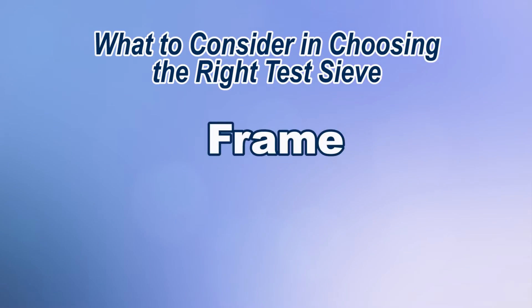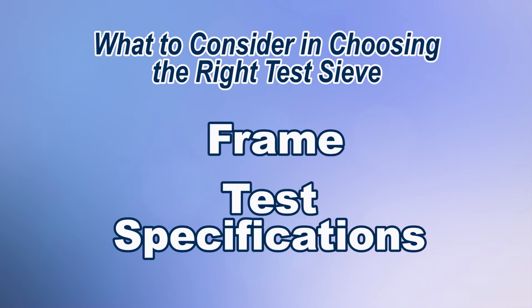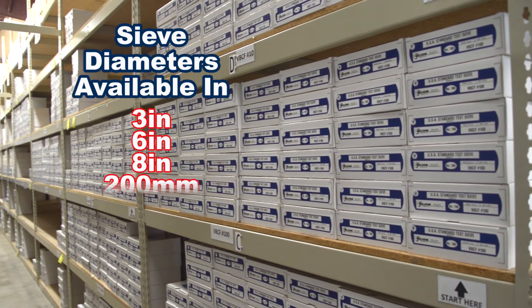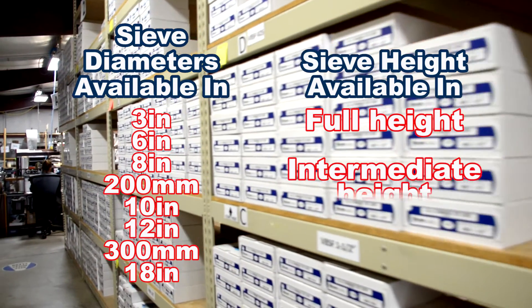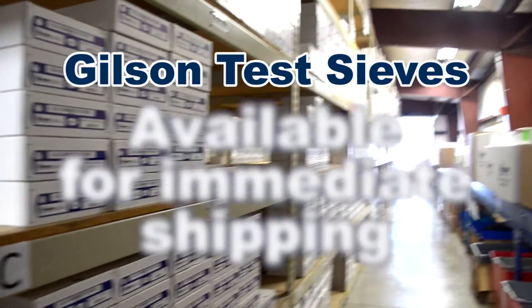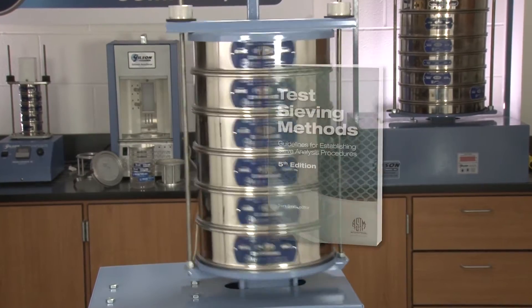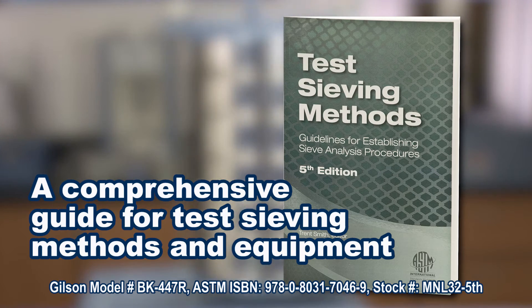It is important to consider the test sieve frame as well as the test specifications required when choosing test sieves for performing gradation analysis. Gilson offers test sieves from 3 inches to 18 inches in diameter, as well as test sieves in full height, intermediate height, and half height sizes, with the most popular sizes available for immediate shipping. Gilson also offers ASTM Manual 32, a comprehensive guide to test sieves, sieving methods, and sieving equipment.